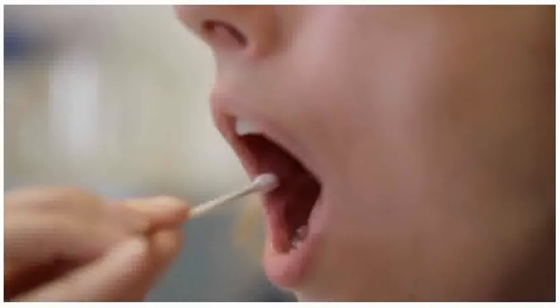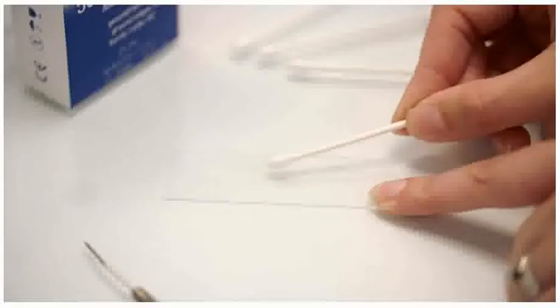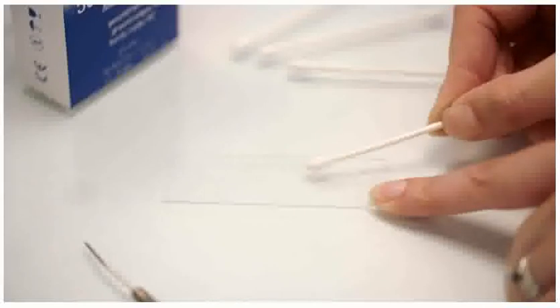A cotton bud is used to rub very gently against the inside of the cheek. Smear the cotton bud onto the center of the slide to transfer the cheek cells. It might not be possible to see anything on the slide because the cheek cells are too small to see with the naked eye.